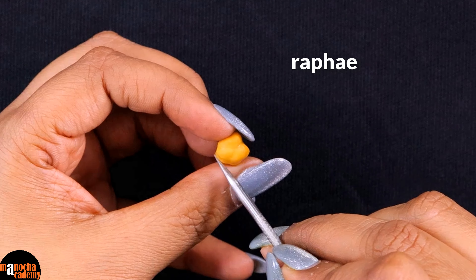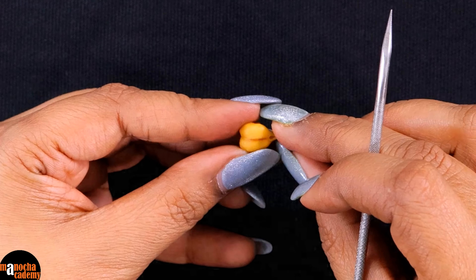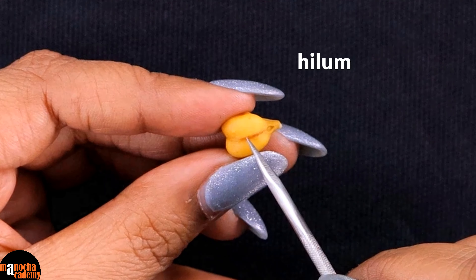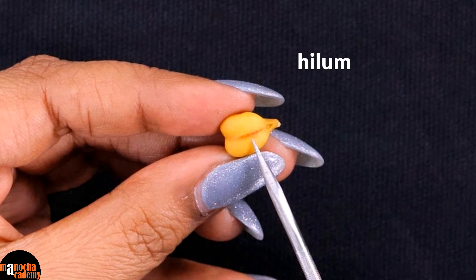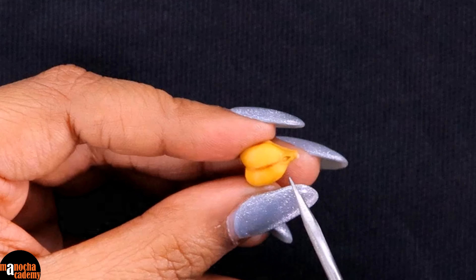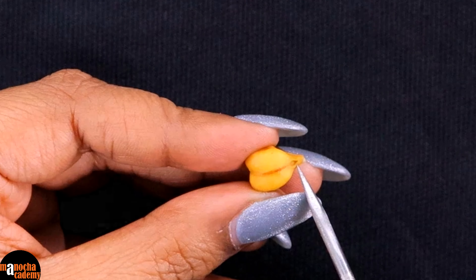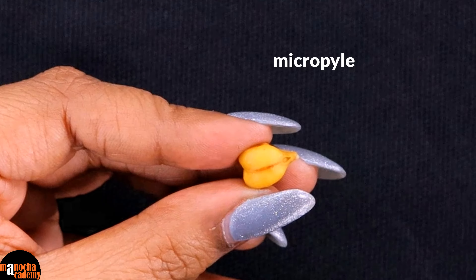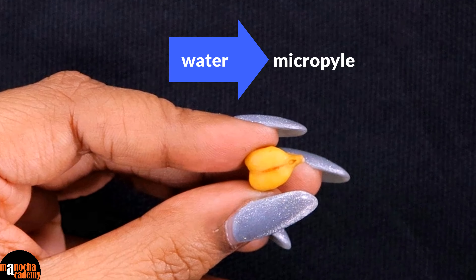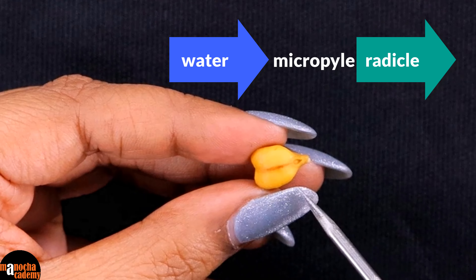The raphe continues for the entire seed in between the two cotyledons. You can see a slightly darkish region here — this is known as the hilum, which marks the point of attachment of the seed to the fruit. Just below the hilum, you see this minute opening, which is called the micropyle. This is the opening through which water enters into the seed for germination, and the radicle, that is the future root, also comes out from this part.